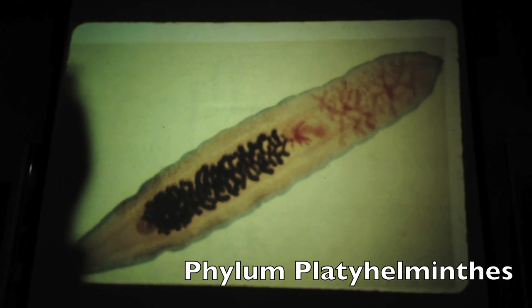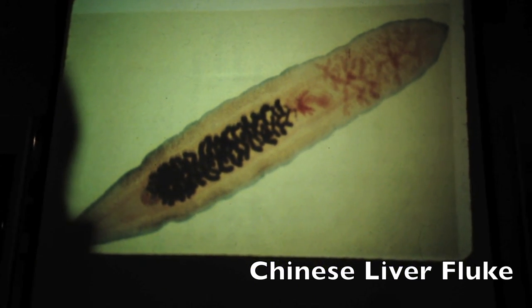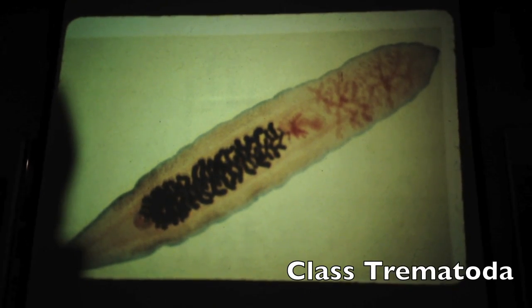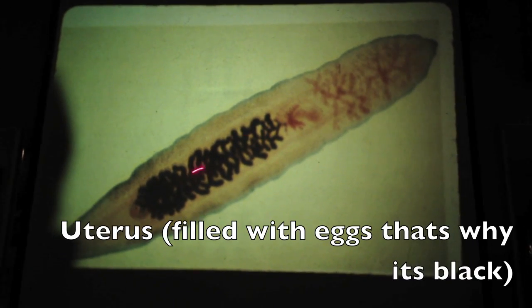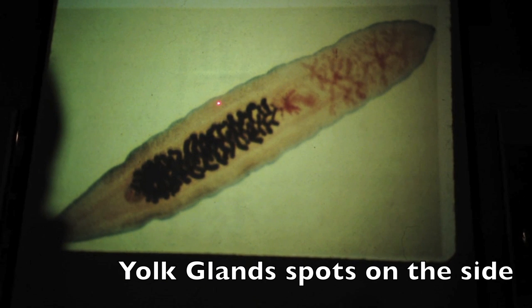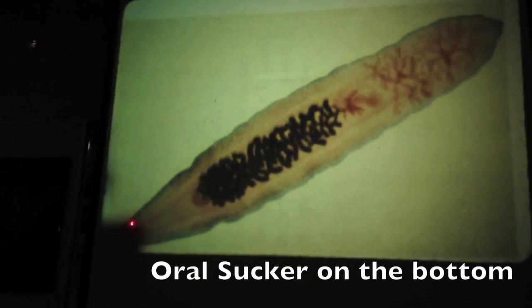Back to Platyhelminthes. Which class is this? Obviously not a tapeworm anymore. I think this is a fluke or a free-living one. This is a liver fluke, Chinese liver fluke, Clonorchis, class is Trematoda. And the parts on this, you should know, are the testes, the ovary, or I'm sorry, the uterus filled with eggs, that's why it's black. Ovaries back here. Yolk glands are little spots on the side. Digestive tract are these two pale lines at the back. There's an oral sucker right there.